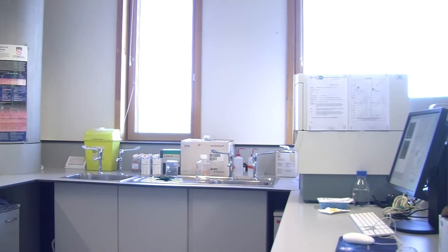Isotype controls. Is that okay? So you will add the isotypes at exactly the same volume, but you just add isotype controls, because it will add another control to your sample. Although you already have a positive and negative control cell line, if you have the isotypes also as controls, you can have more basis to actually discuss your data.